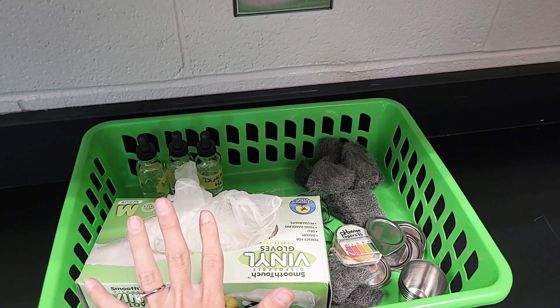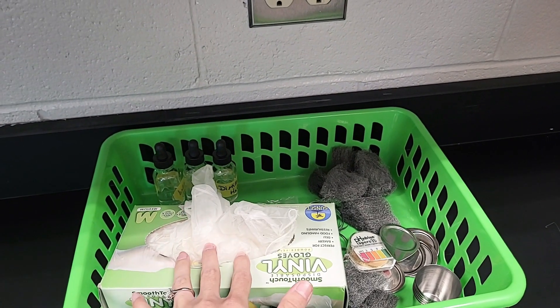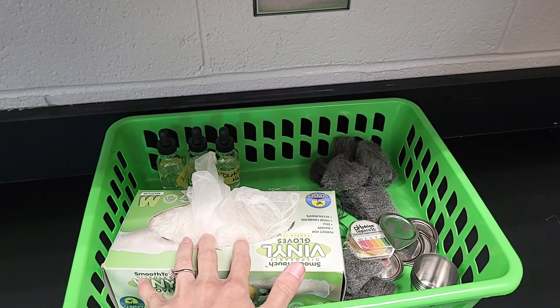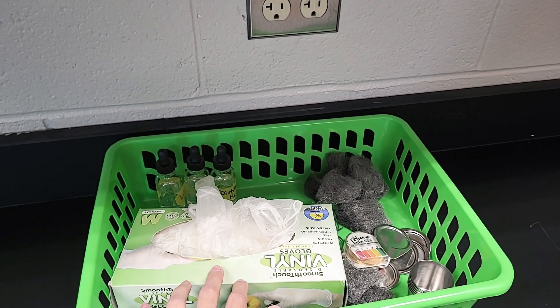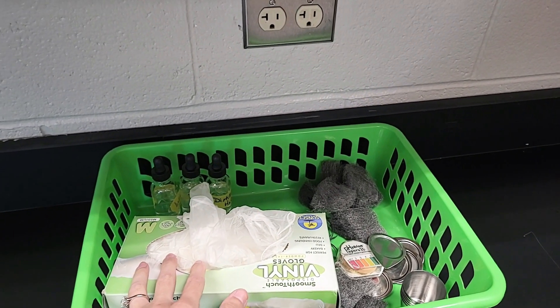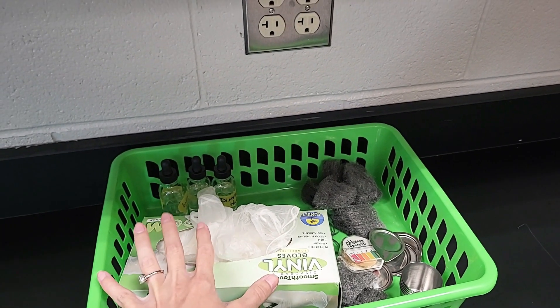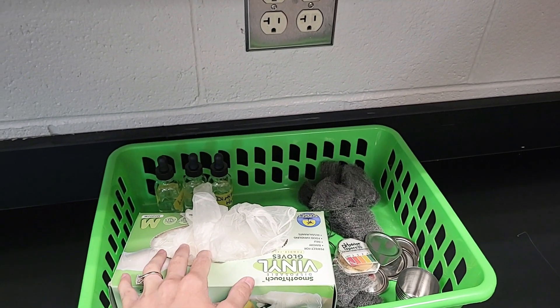I also love the covers — it's so much easier for the kids to grab them with the crucible tongs. It's a very easy lab setup, which makes it great for me because it's been a crazy couple of weeks. Now I'm going to start preparing for the rest of my AP classes, since not all my AP classes have lab today, and then I'll talk about what I do with my lab stations.